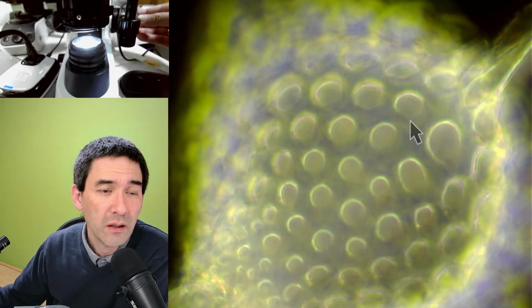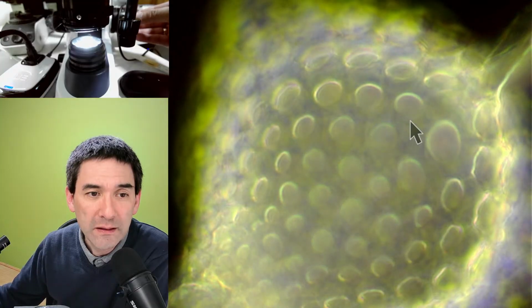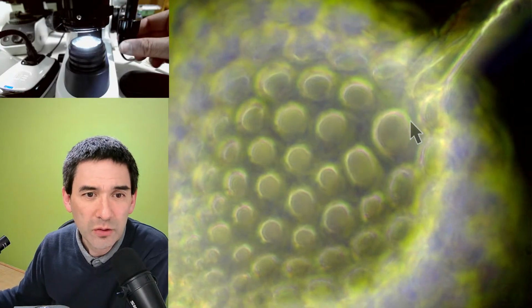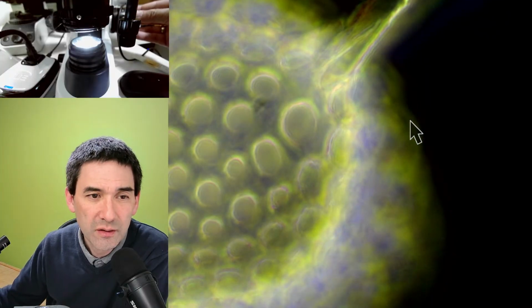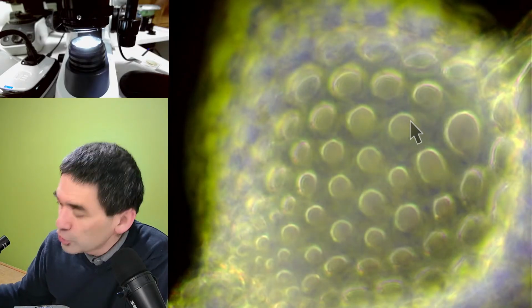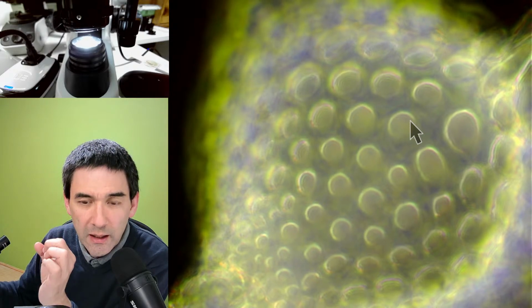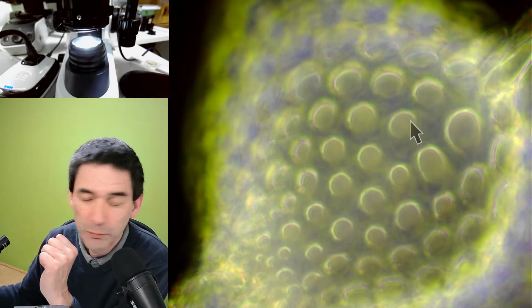But because you have to open the diaphragm completely, for this reason the depth of field is also going down. So this basically means that it does not look quite as sharp and crisp, because some parts are always out of focus. So that's the thing a little bit. Generally, I recommend, and right now this is a 17 millimeter patch stop in the center, right? And if you make it too small, then the background is not going to be completely dark, right?